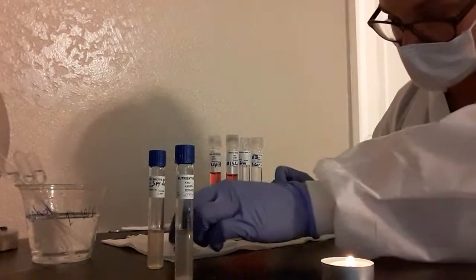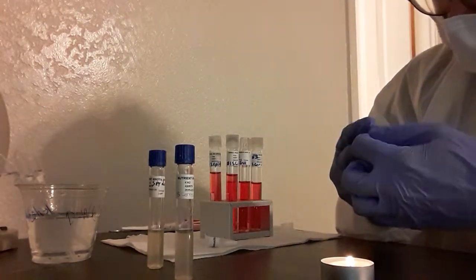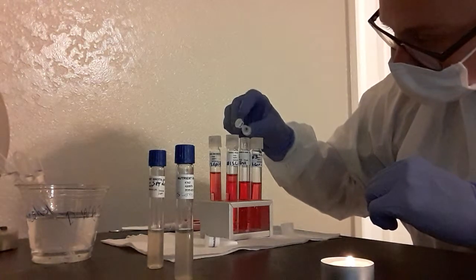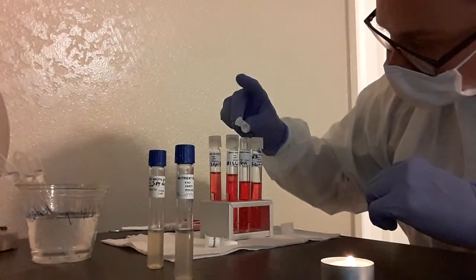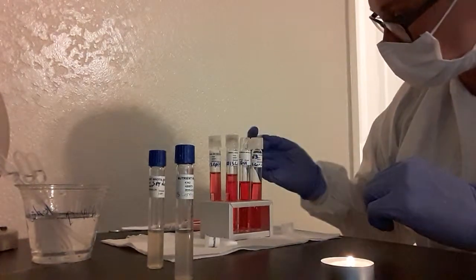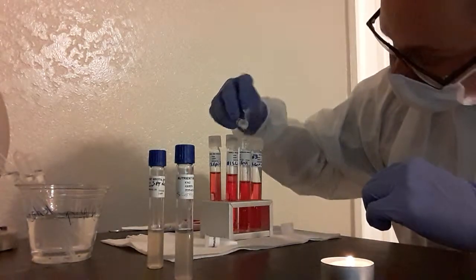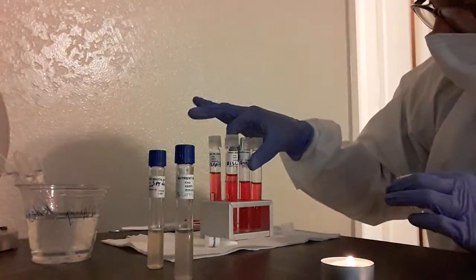And now we're going to take our fructose and dump half of this into this number 2, if it comes out. Let's try something else here. All right, one more time. All right, so now that it's in there, finally, I'm going to re-sterilize.